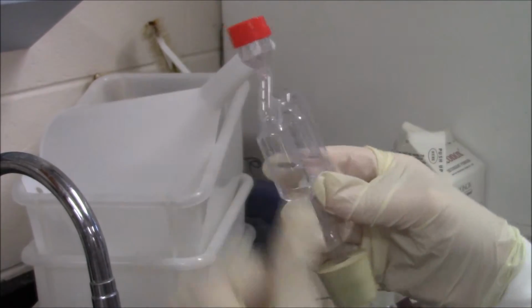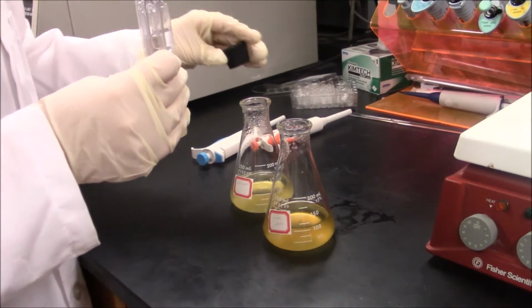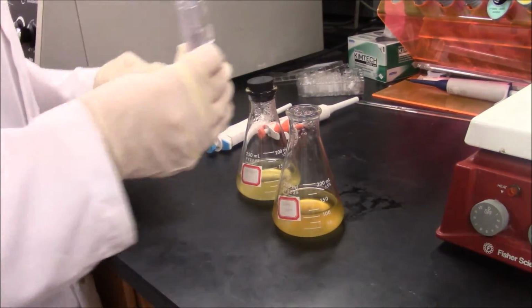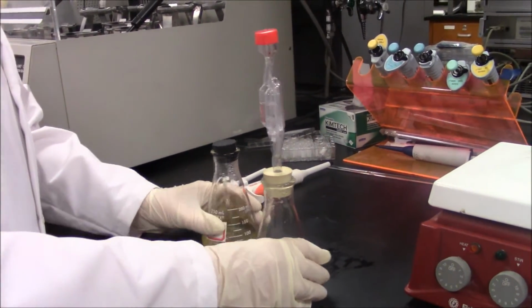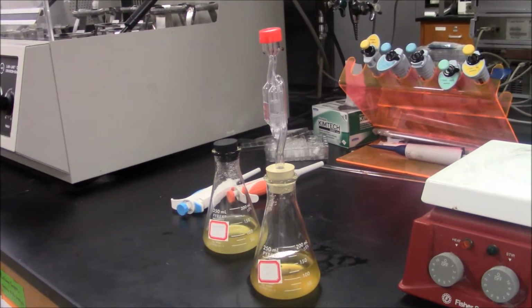Bubbles of CO2 should be produced throughout fermentation after startup period. The purpose of the airlock is to allow bubbles to escape and to keep other substances from entering, like air. A bubbler could also be put on the buffer solution to show in the absence of glucose you won't observe bubbles because there is no fermentation taking place.